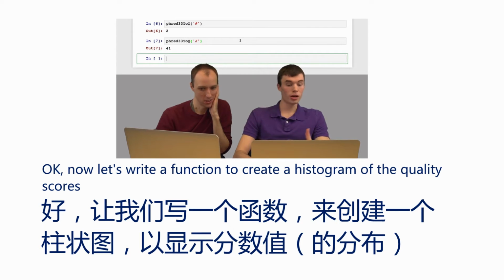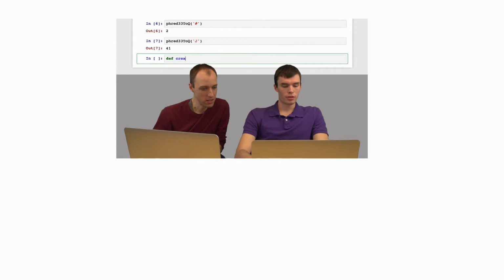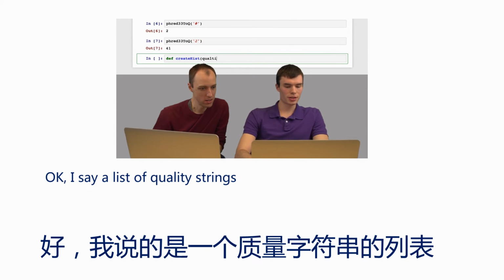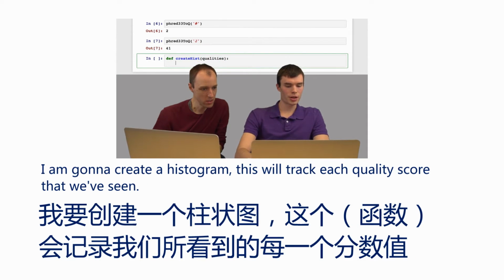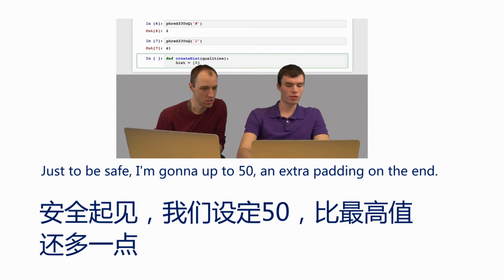Okay, now let's write our function to create a histogram of the quality scores. So I'm going to write a function, create hist. We'll pass in a list of quality strings. I'm going to create a histogram. This will just keep track of the frequency of each quality score that we've seen. I think the highest quality score you can see is actually 41, which we saw. Just to be safe, I'm going to go up to 50, so that should give us some extra padding on the end.